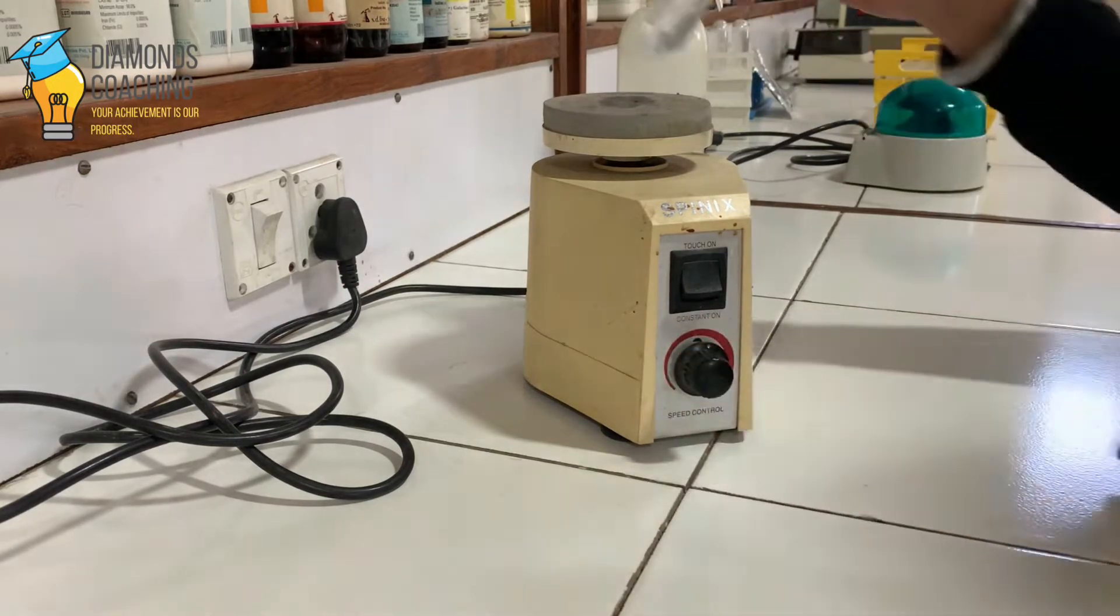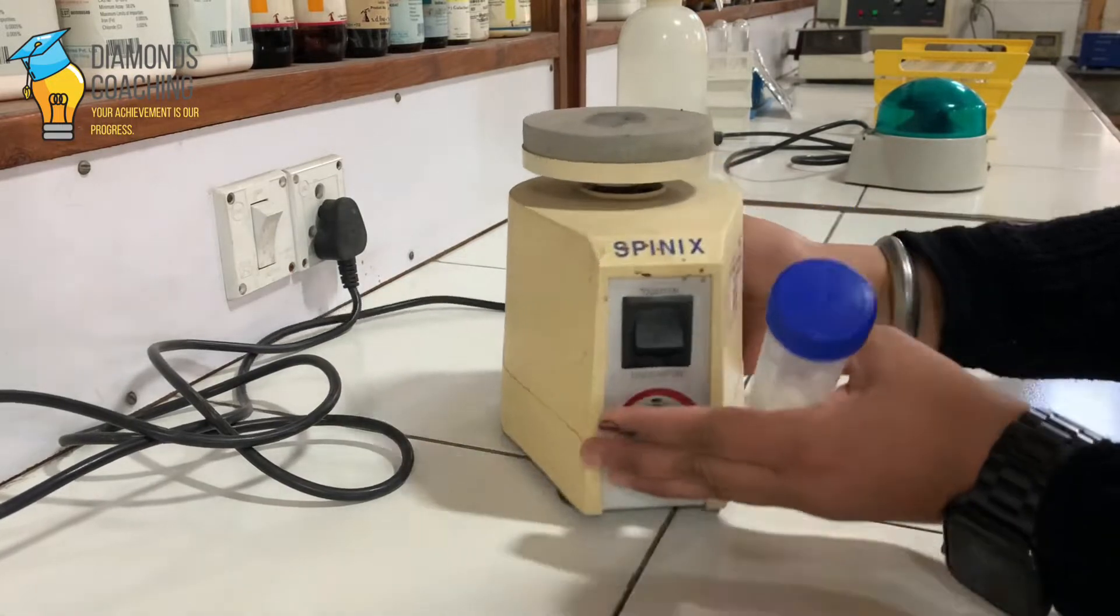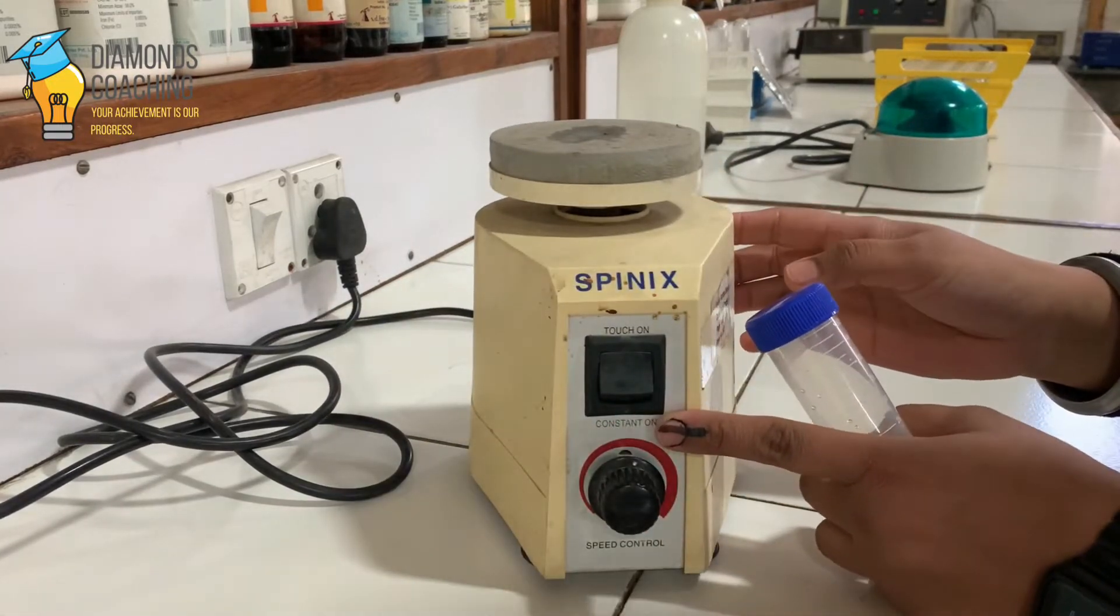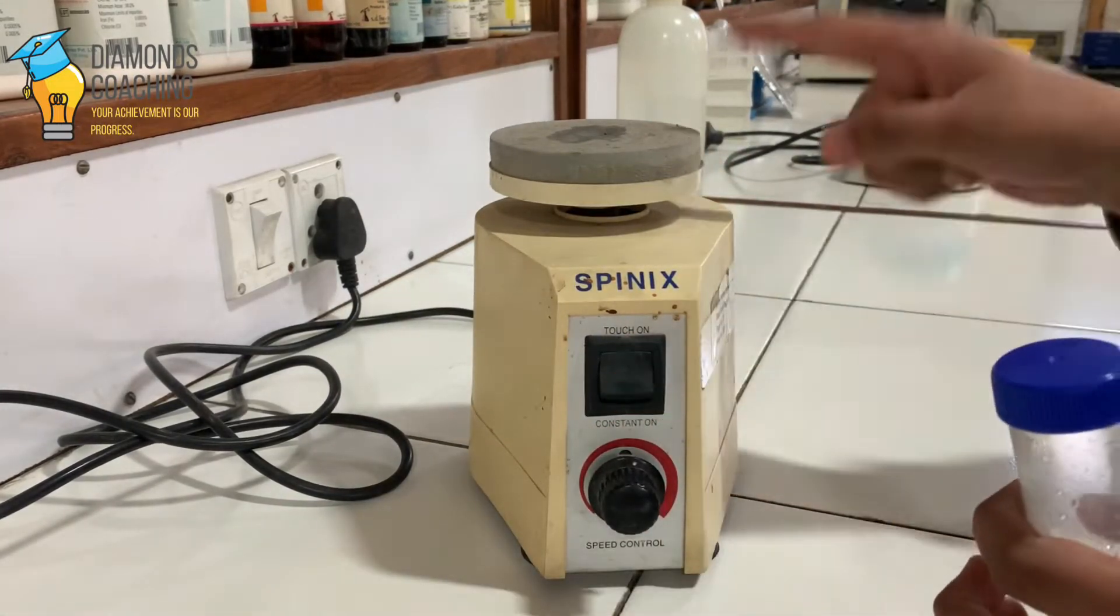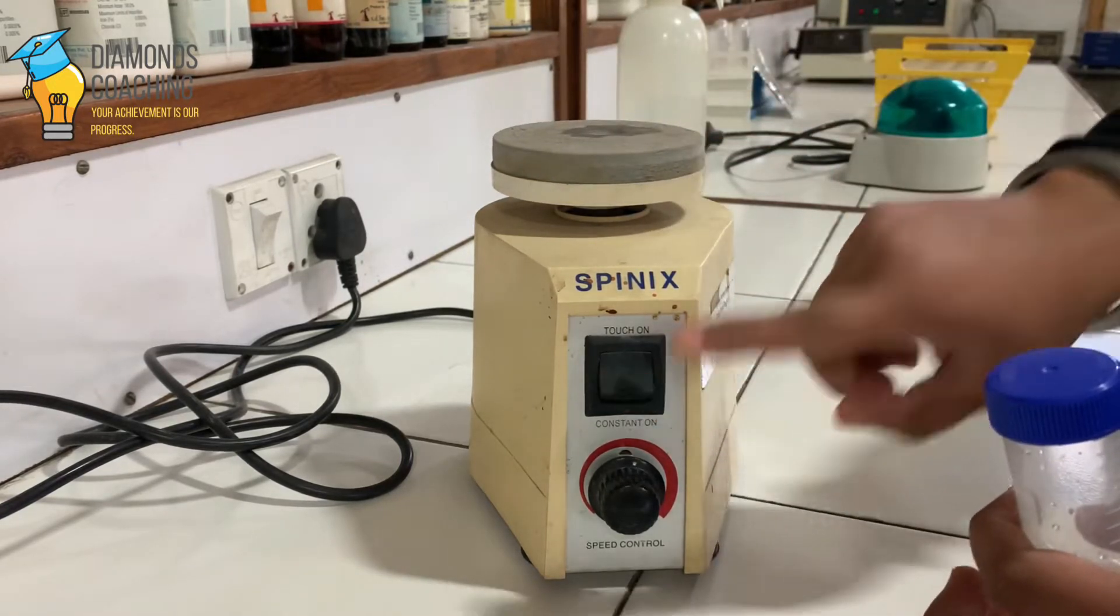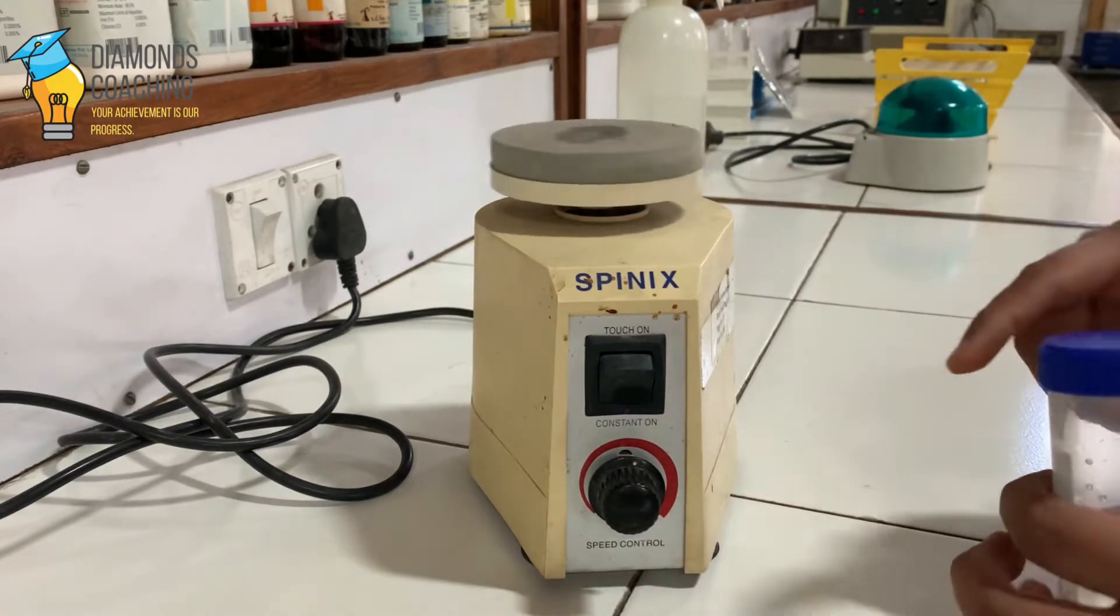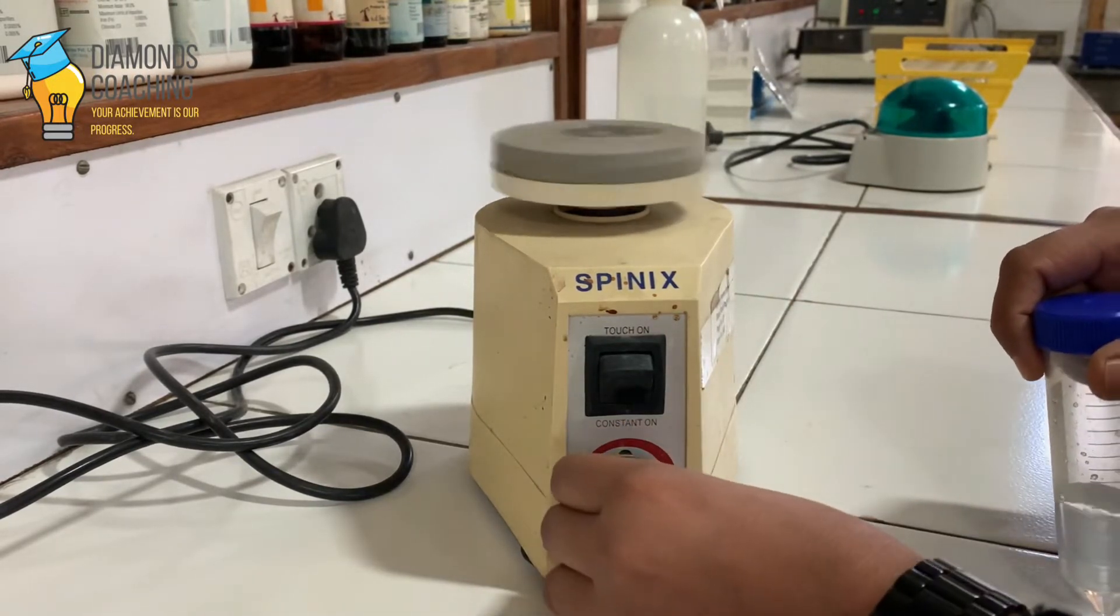Another option is constant-on. This option means even if we don't touch this surface, still it will work and keep on moving or shaking. So see this here.